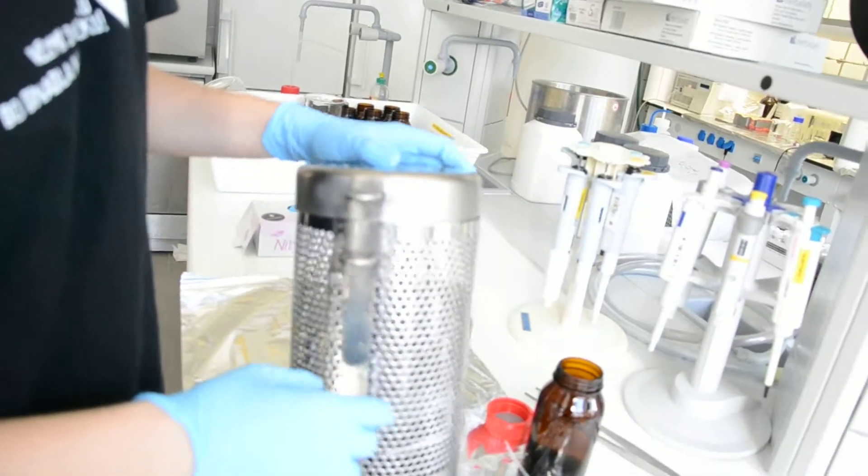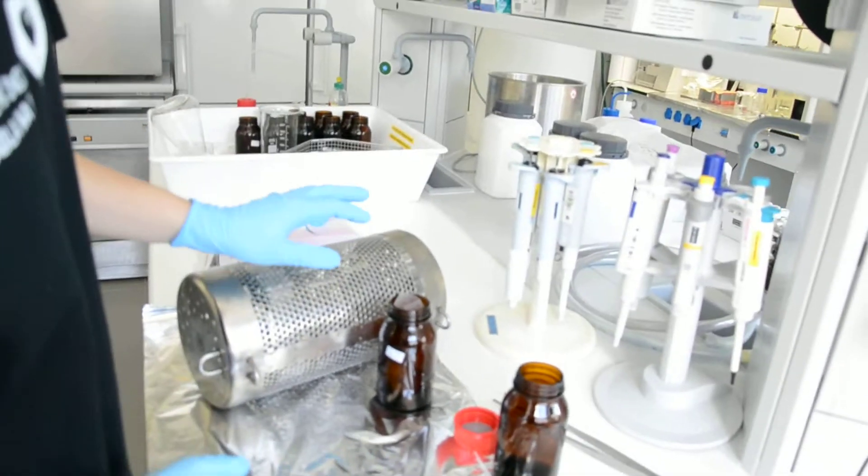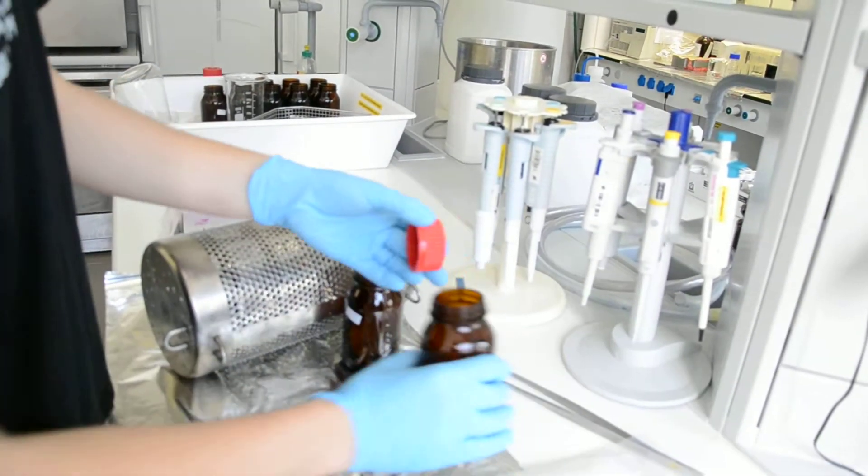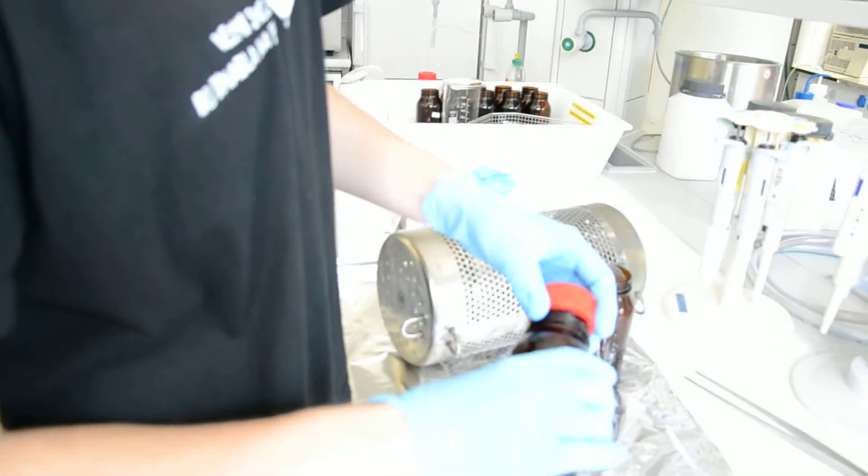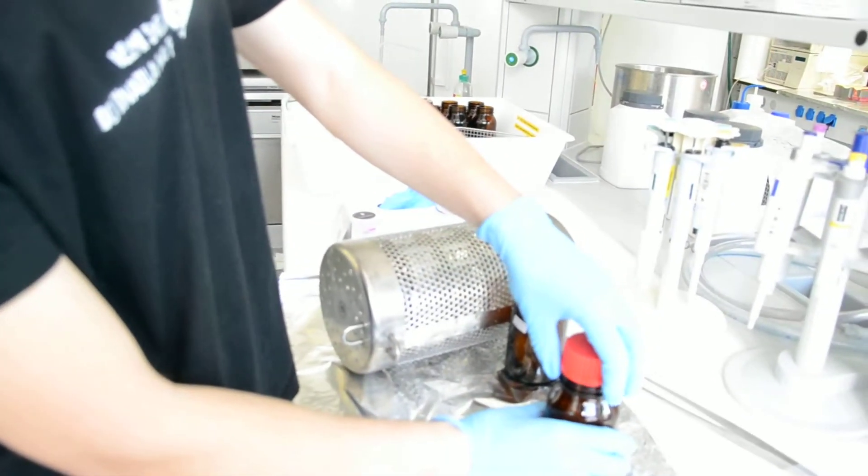Close the field blank. That's important. And in the end, when you deploy the cage, you close the bottle with blank sheets. Like this. And you store in the freezer.